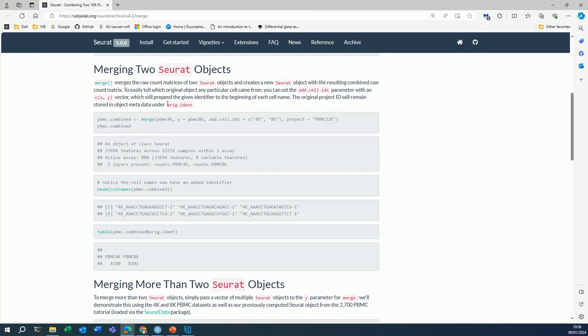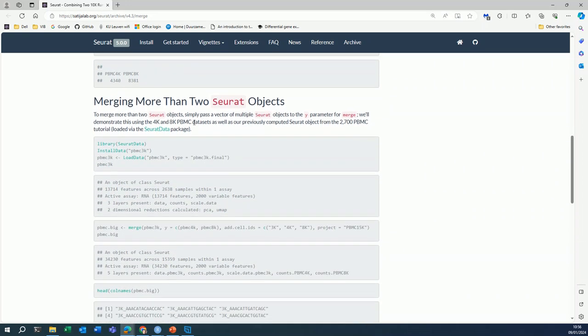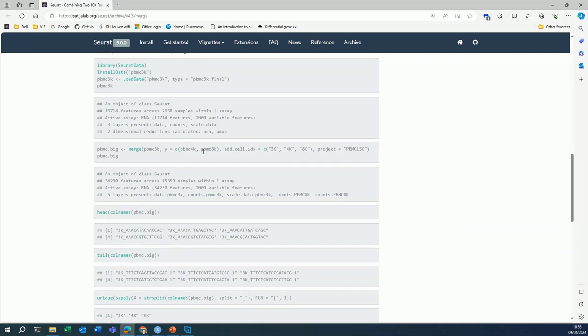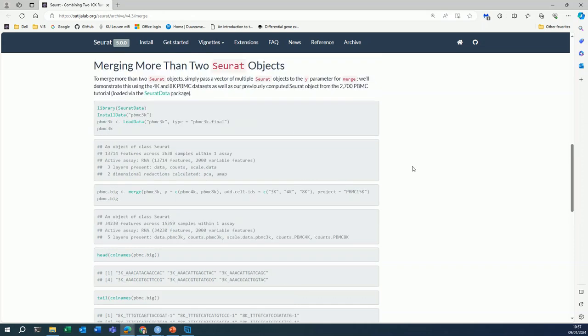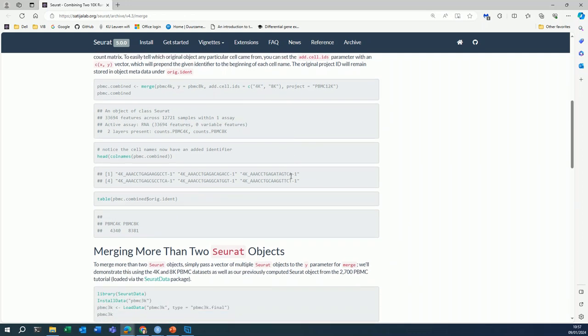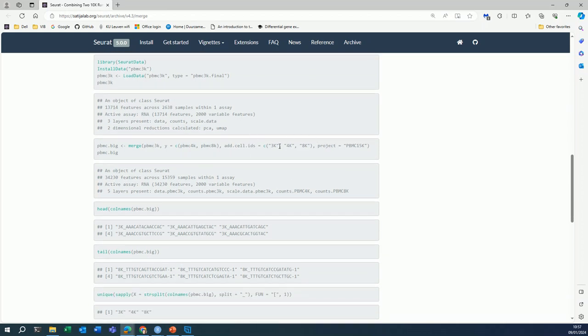So to merge two Seurat objects, you are going to use the merge function. This here is the first Seurat object, and the Y argument is the second Seurat object. You can merge more than two Seurat objects. In that case, the Y argument will be a vector containing multiple Seurat objects. What is important here is also this argument, add cell IDs. What you write here is an ID for every sample, for every Seurat object that you are going to merge. So when you merge two Seurat objects, the value of this argument will be a vector with two IDs. When you merge three Seurat objects, the value of this argument will be a vector with three IDs. So one ID per sample.